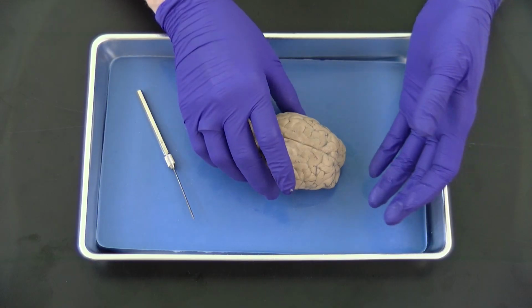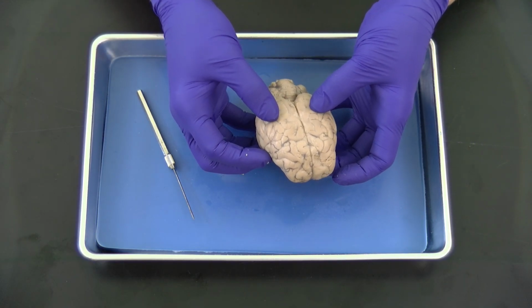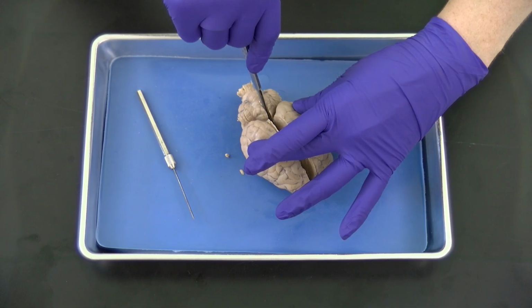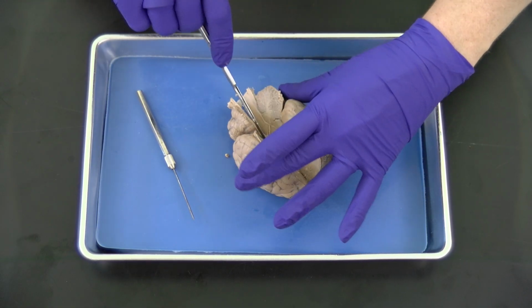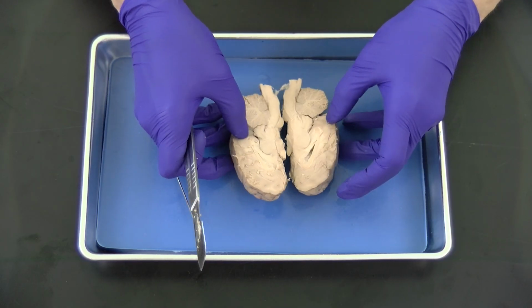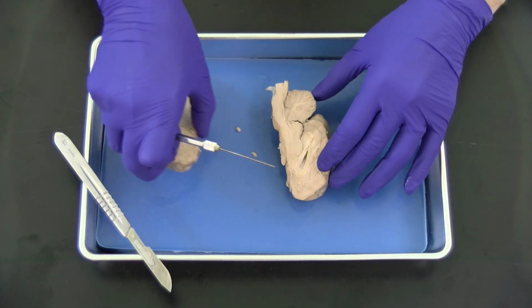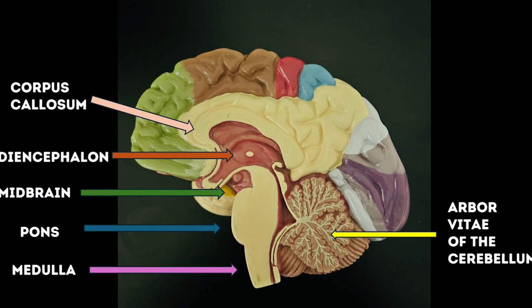Okay, so that is the external anatomy of our brain. Now I'm going to dissect the brain so we can look at the interior structures. All right, so I'm just going to cut right down this longitudinal fissure and then directly through the center of our cerebellum. And that is a beautiful section. So I'm going to move one half out of the way so that we're just looking at a singular half here.